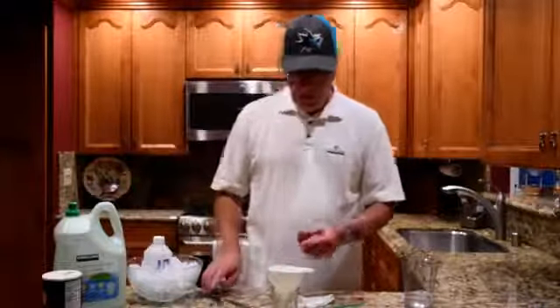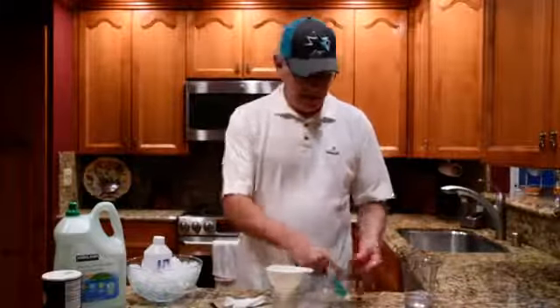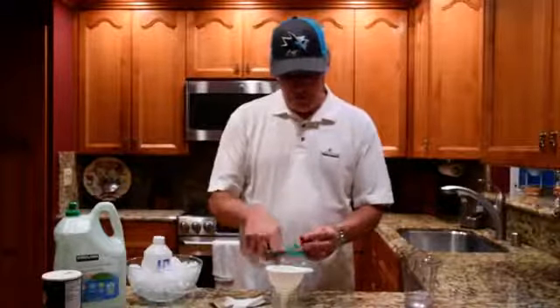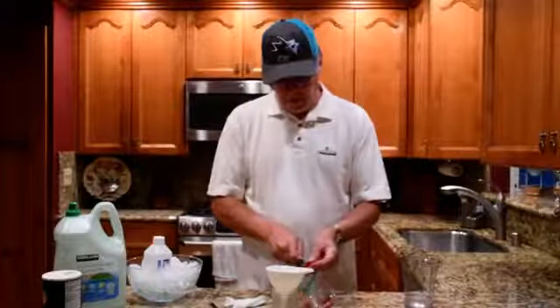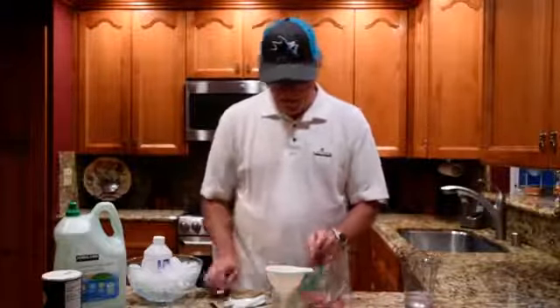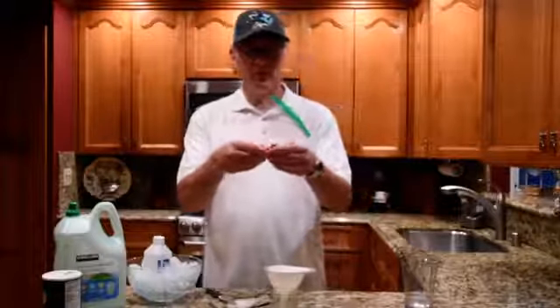What we're going to do is cut up the strawberry to make it easier to get the cells broken up. I'm going to help myself by slicing the strawberry into a lot of different pieces and then putting it into the baggie. Once I have it in there, I'm going to start to smush it up. The more we smush, the more cells we're going to be able to get the DNA out of. So the more time you spend smushing, the better off you will be. Just close it up and smush up those pieces as best you can — you want kind of a gooey mess. Try not to do it so much that you break the baggie though.